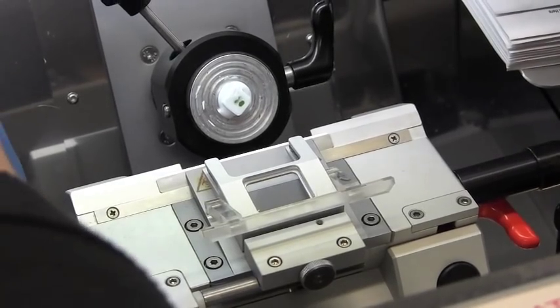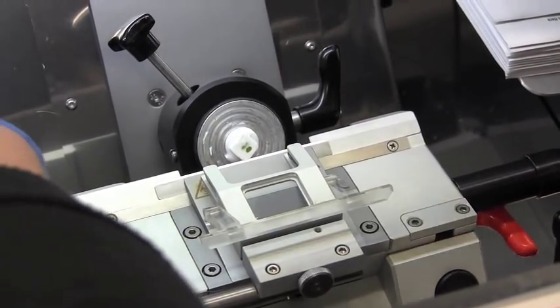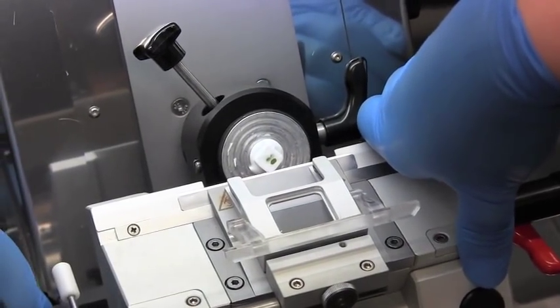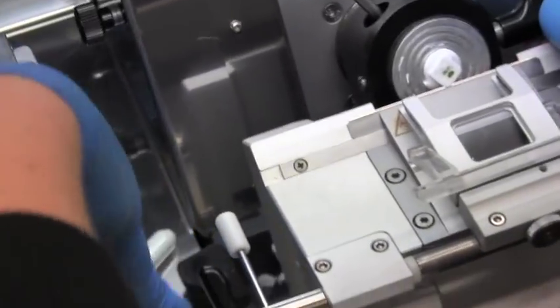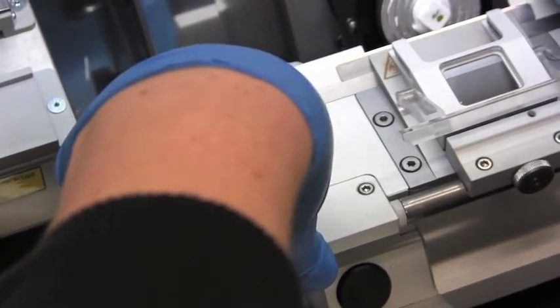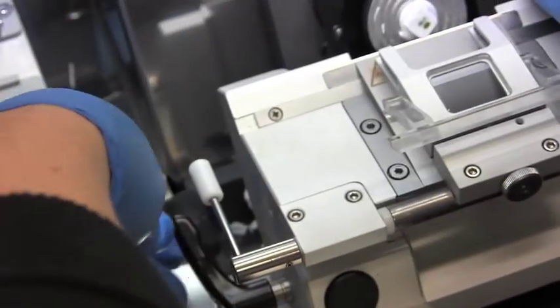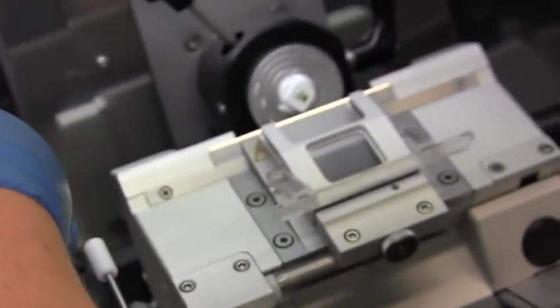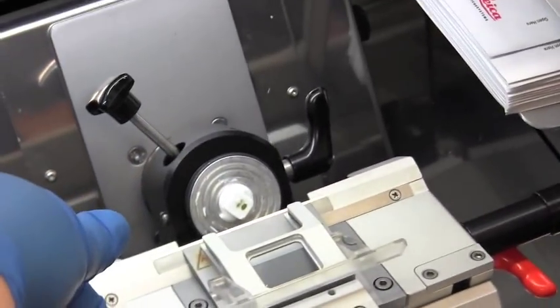At this point I want to get that plane as flat as possible. So I'm actually going to adjust the blade. And remember how I do that is to move this bar, loosen it, and then turn this whole thing just a tiny bit. And hopefully when we advance we'll get a flatter section.